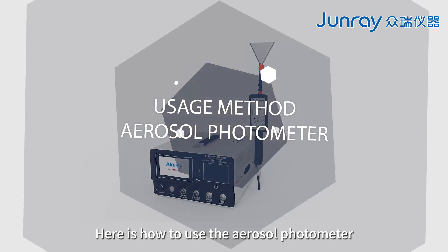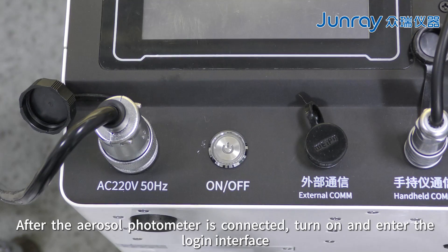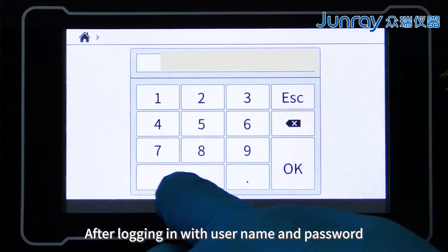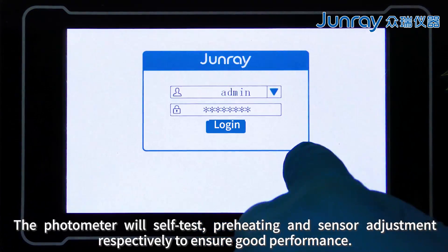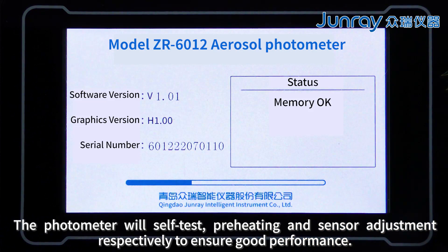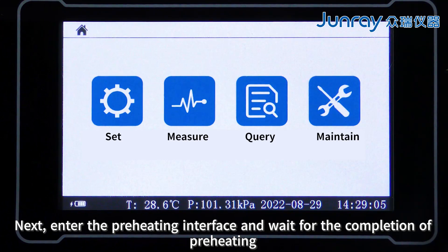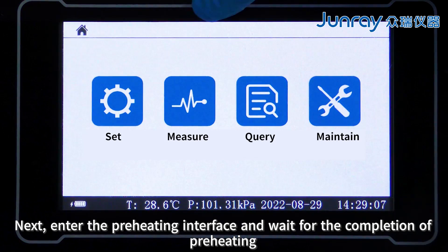Here is how to use the aerosol photometer. After the aerosol photometer is connected, turn it on and enter the login interface. After logging in with your username and password, the photometer will self-test, preheat, and perform sensor adjustment respectively to ensure good performance. Next, enter the main interface, which includes setting, measurement, query, and maintenance.